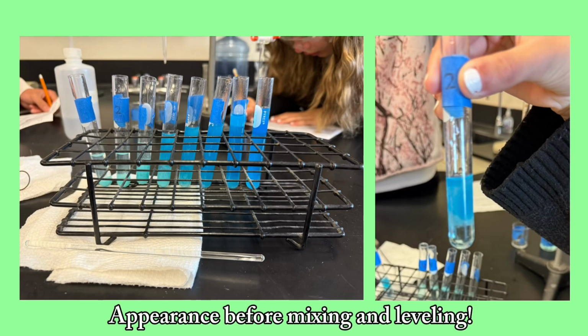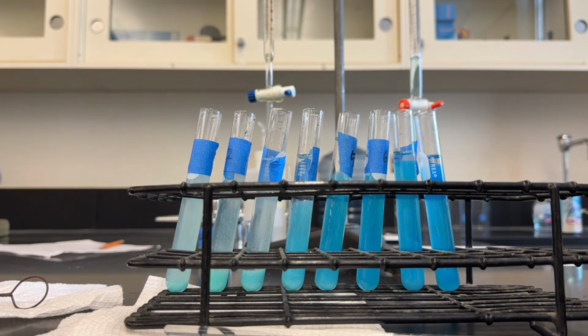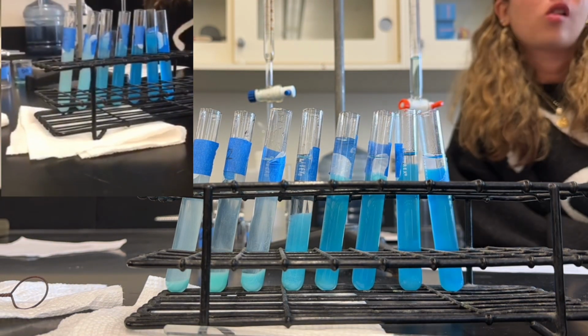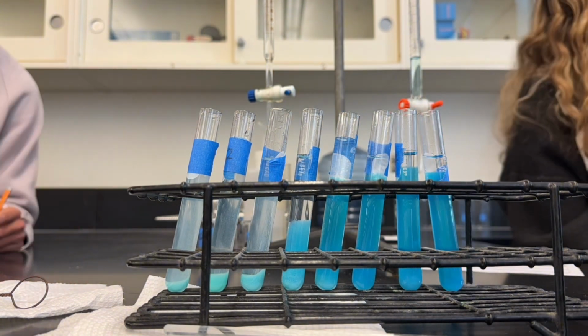Then we dispensed 0.2 molar KOH in every test tube, each increasing by 1 milliliter after another. We then leveled out the test tubes to be 13 milliliters each by adding distilled water. After evening them out, we stirred them thoroughly. After 15 minutes, the precipitate settled at the bottom. Then we were able to measure their heights with a ruler and see the trend.